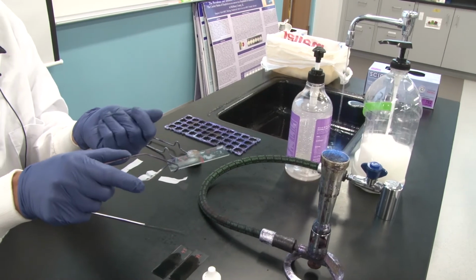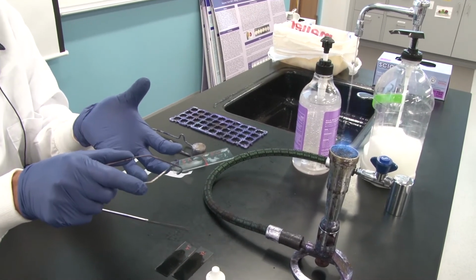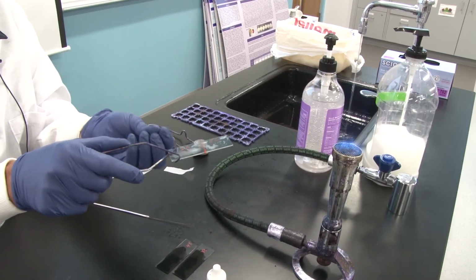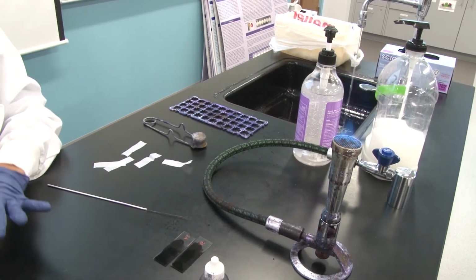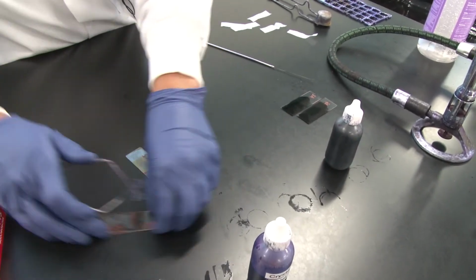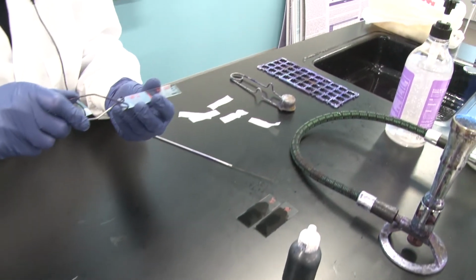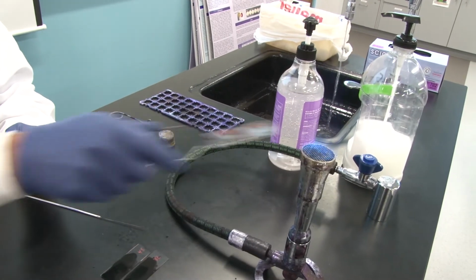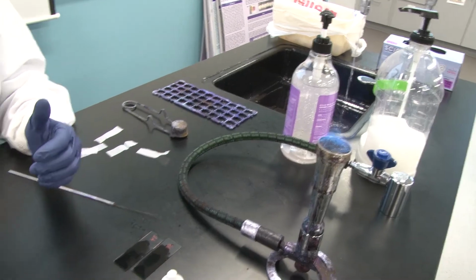But every one of these cells has a little bit of a diffuse slime layer made of polysaccharides or glycoproteins on the outside of their cells. And when I heat that, like sugar when it's melted, it sticks to the surface. So these cells are now stuck to the glass. Why did I need to do that? I needed to do that because if I didn't and I added these water-based dyes, the cells would simply wash right off the slide.